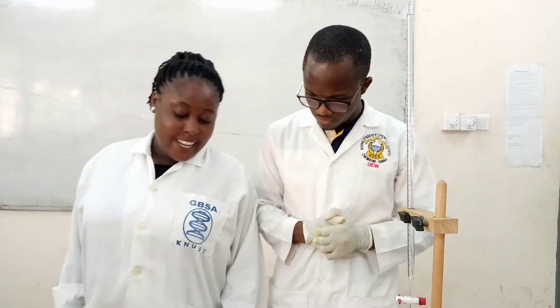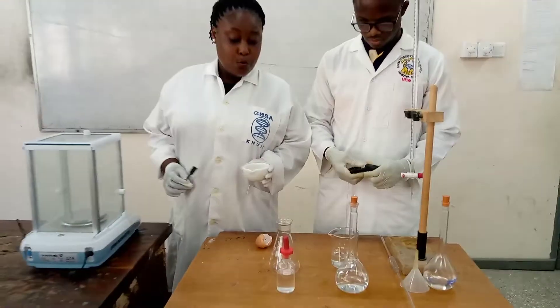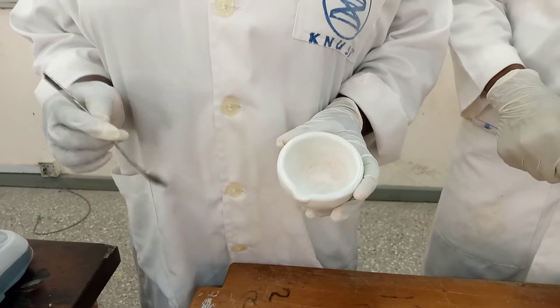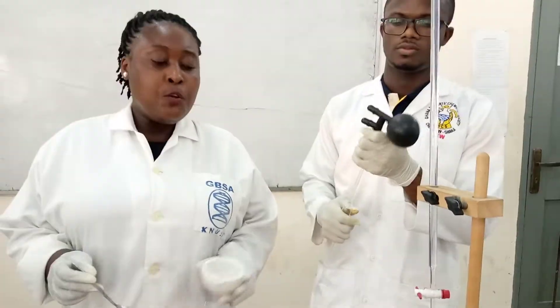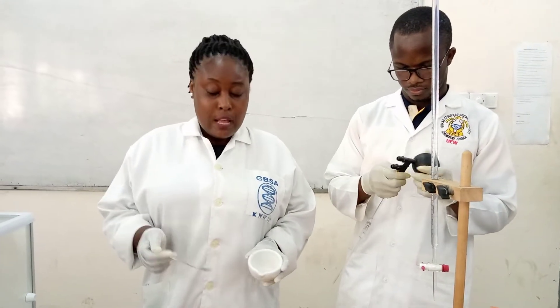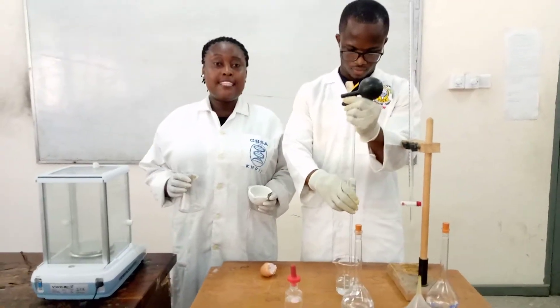You need 0.6 grams of the eggshell — I've already ground it into powder, so I'm going to weigh 0.6 grams of the eggshell. My colleague is going to pipette 25 ml of 1 molar HCl. We are going to react the HCl with the calcium carbonate content in the shell, so I'm going to do the weighing and Mr. Kiyah will pipette the acid for us.